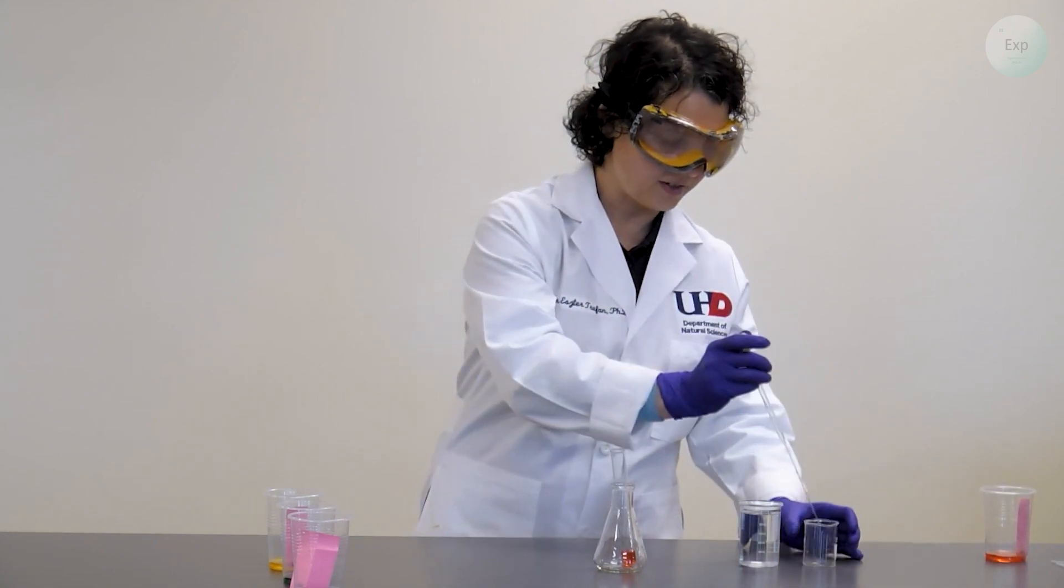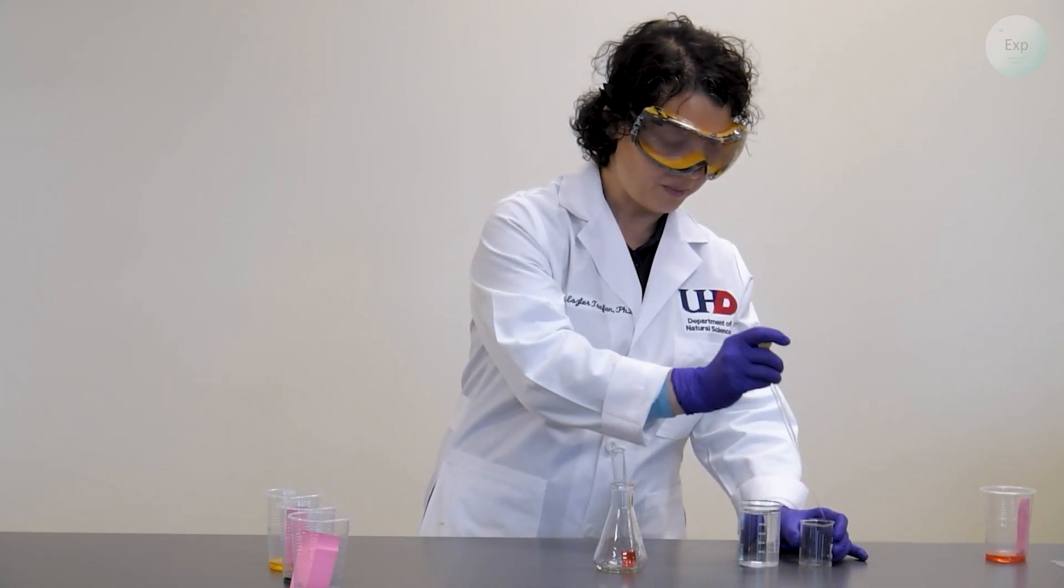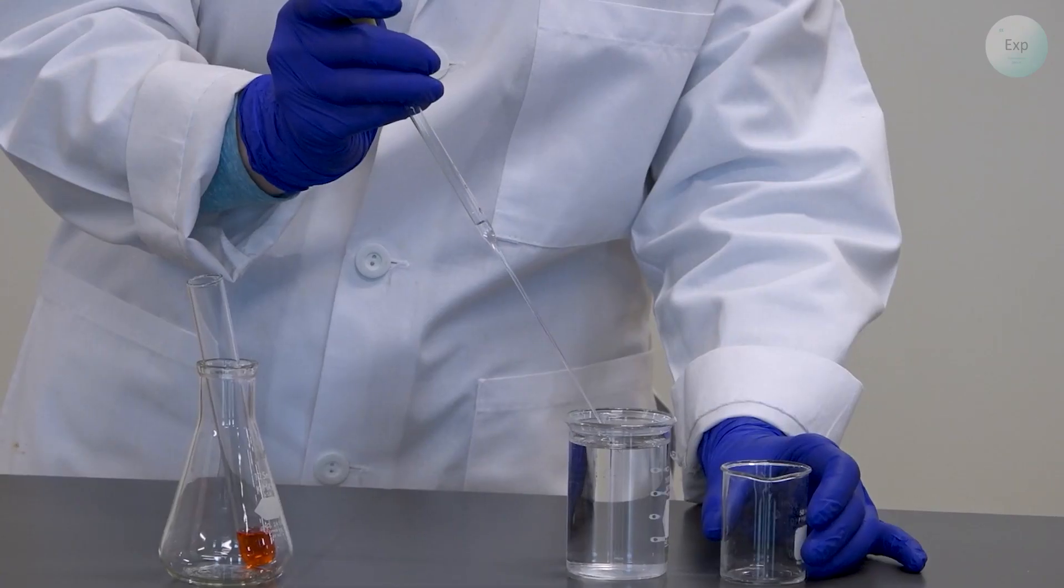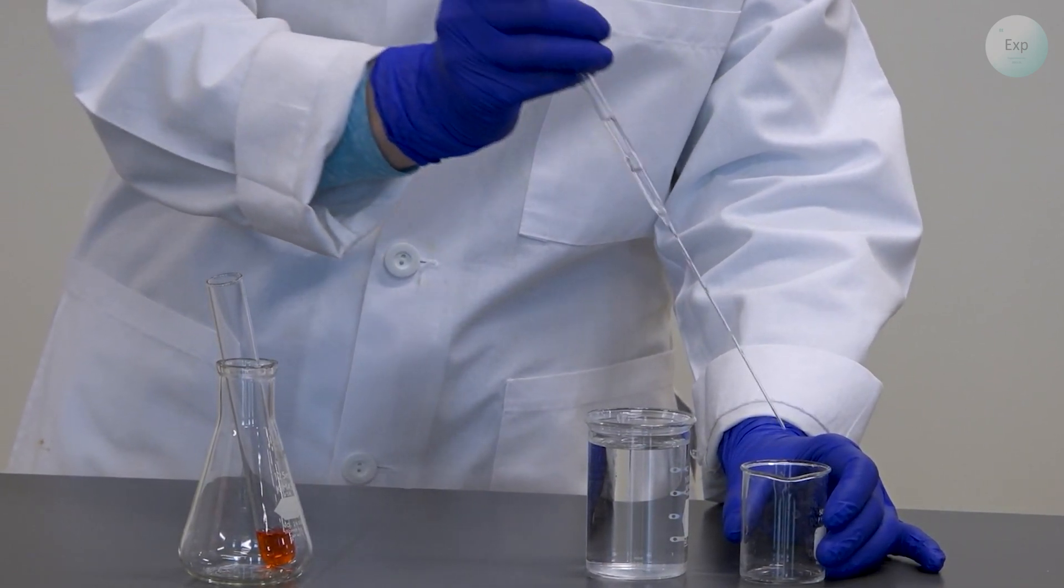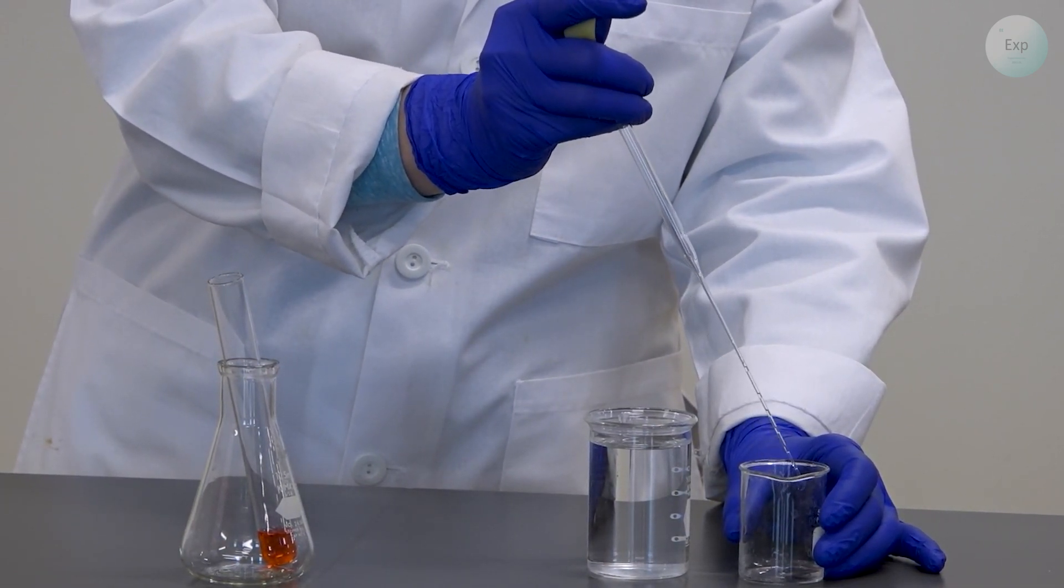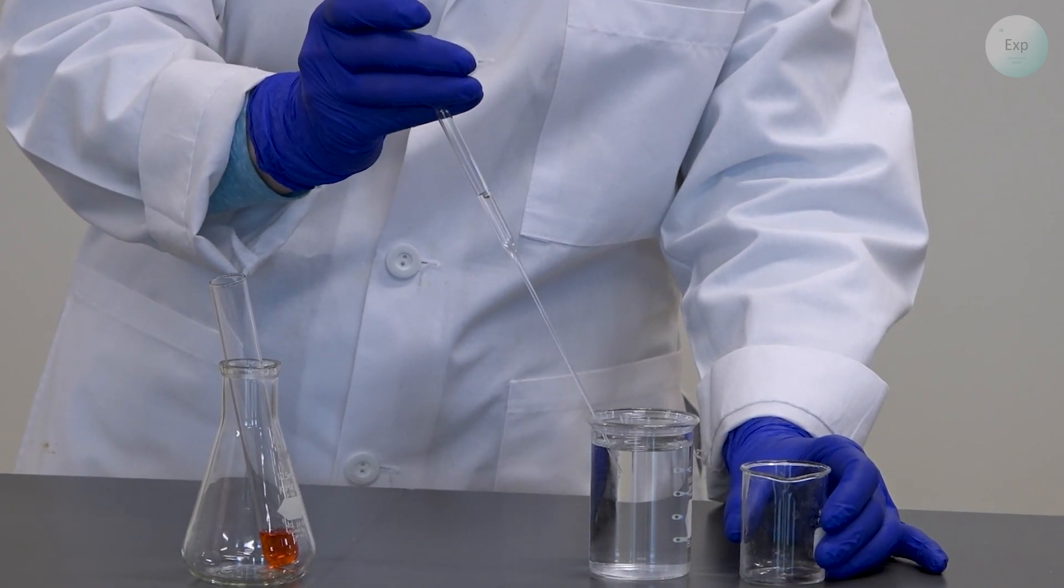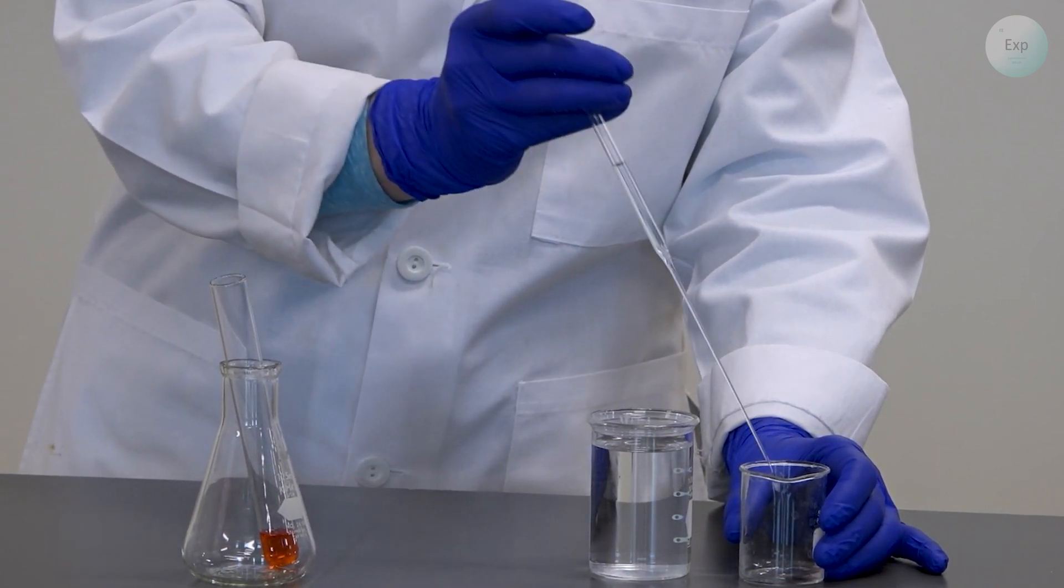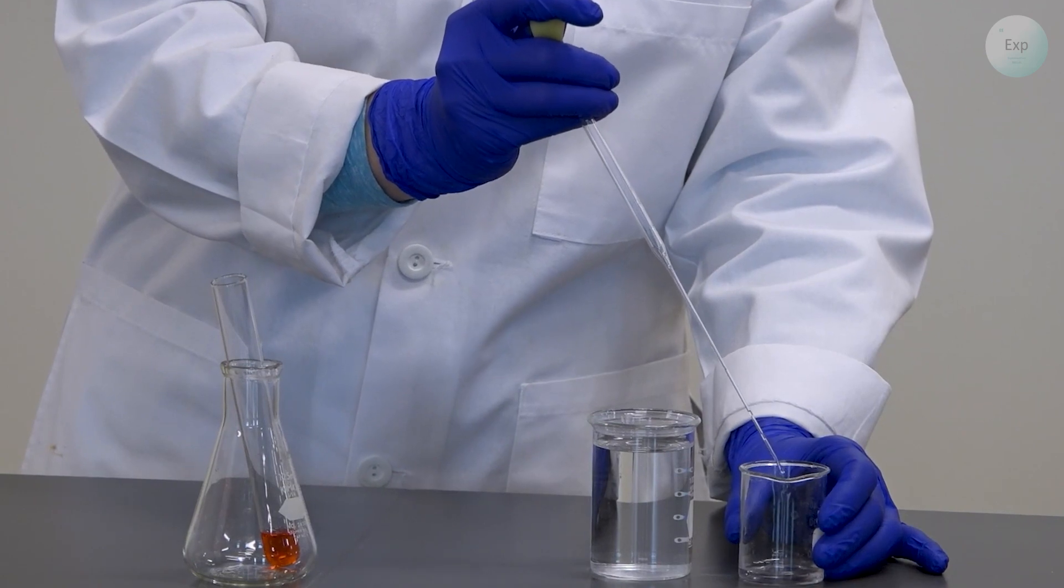I will set my red solution to the side, squeeze it out in my waste container and then pull up some water so that I can rinse off my red solution. Ideally one would do this two or three times to consider the pipette ready for the next use.